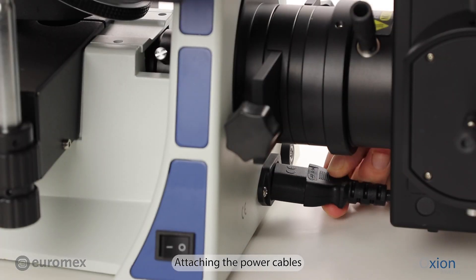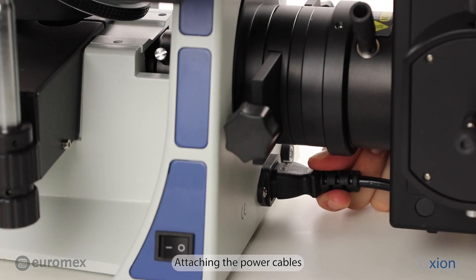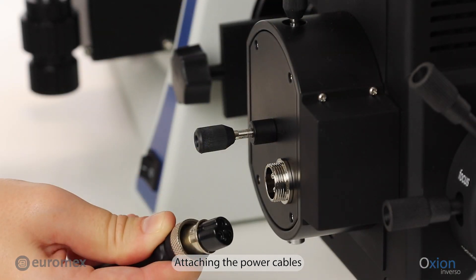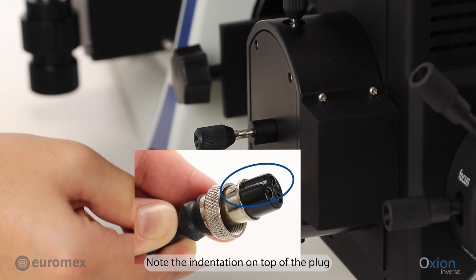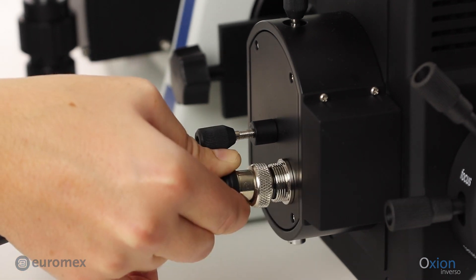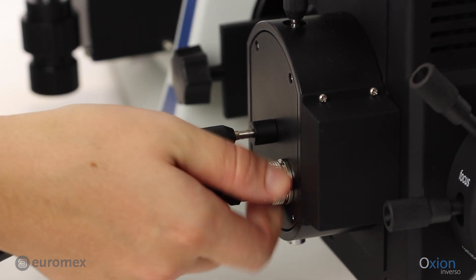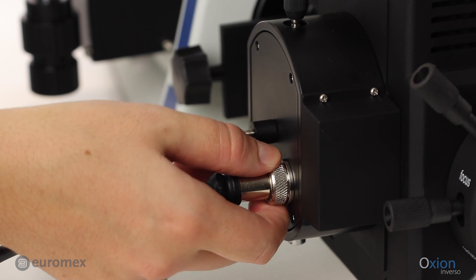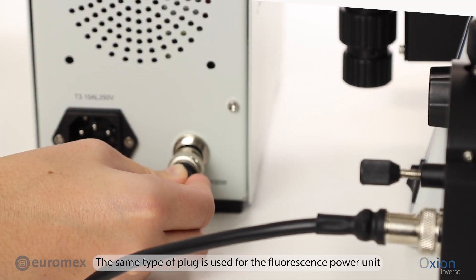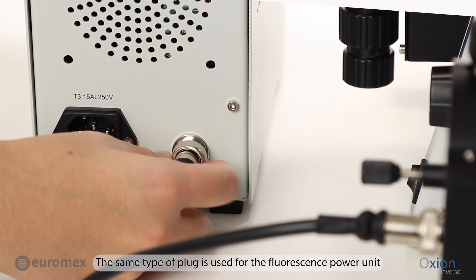Attaching the power cables. Note the indentation on top of the plug. The same type of plug is used for the Fluorescence power unit.